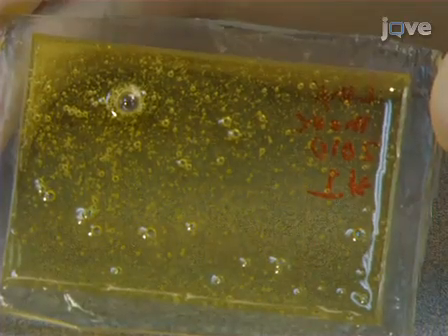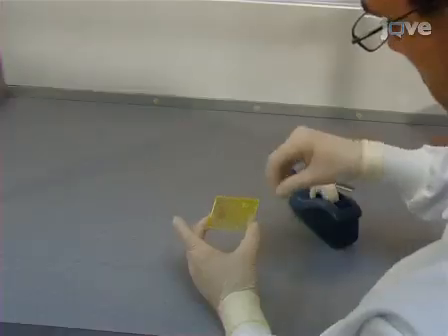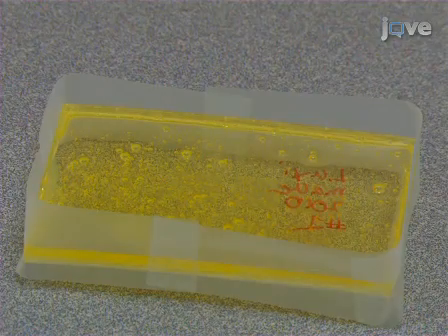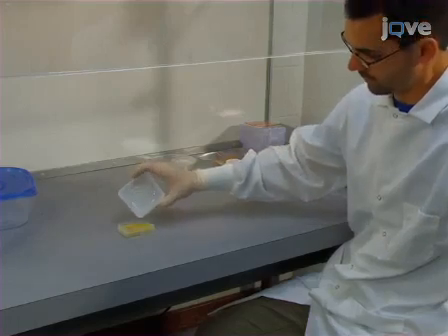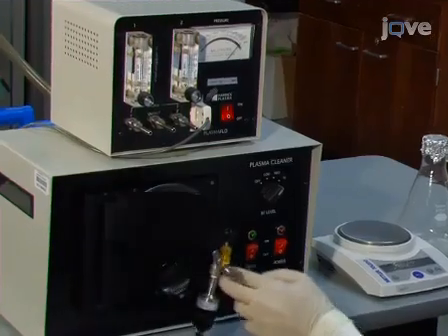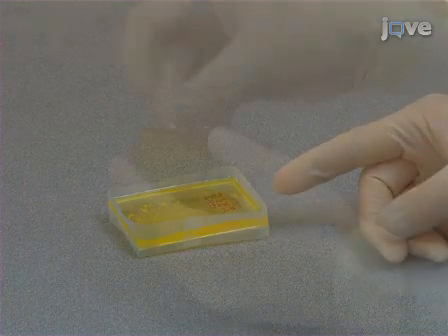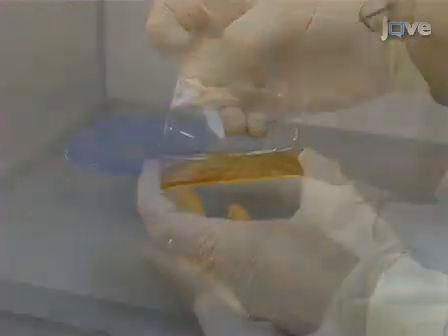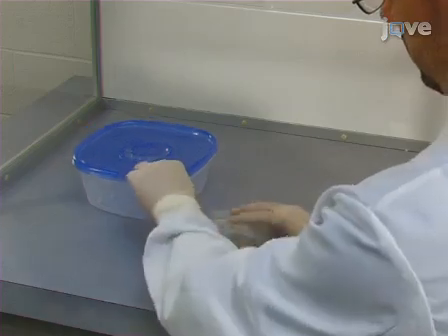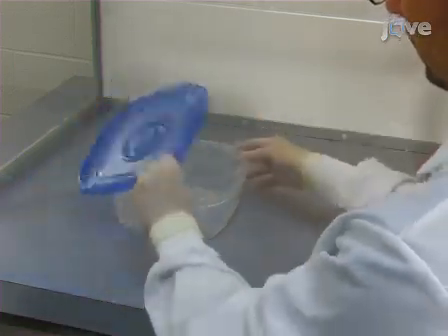Once the epoxy mold is cured, remove the epoxy from the PDMS master mold and then wrap tape around the epoxy mold to form a container. A working mold can then be created by pouring PDMS onto the epoxy mold, degassing the PDMS, and curing the new mold for 1 to 2 days. After the working mold is cured, peel the mold off of the epoxy and store both inside petri dishes in a sealed plastic container inside the flow hood to maintain cleanliness.